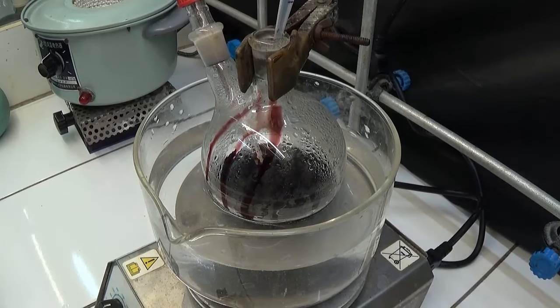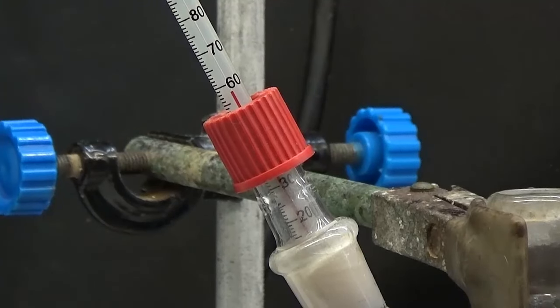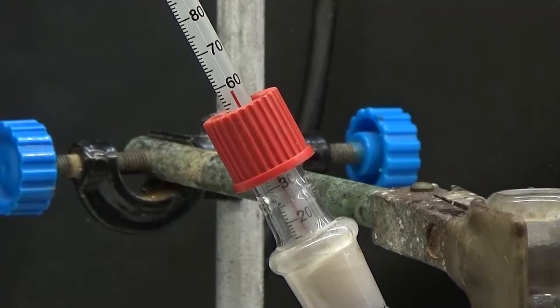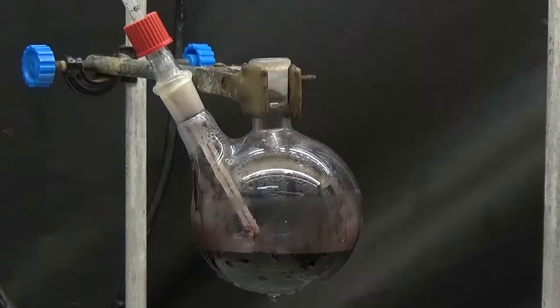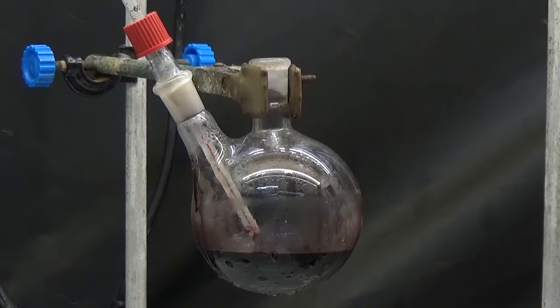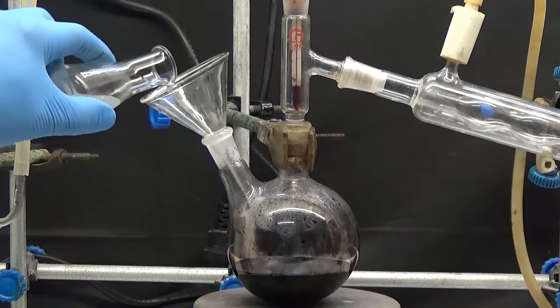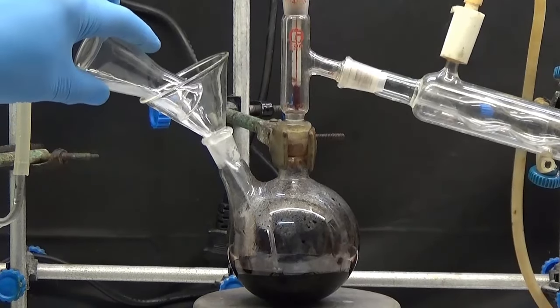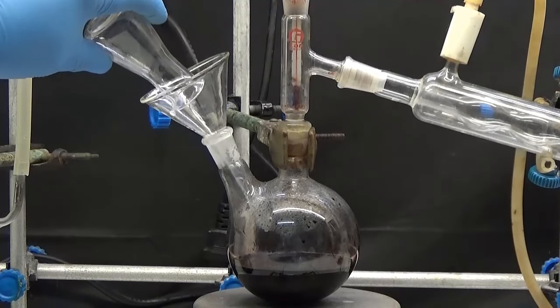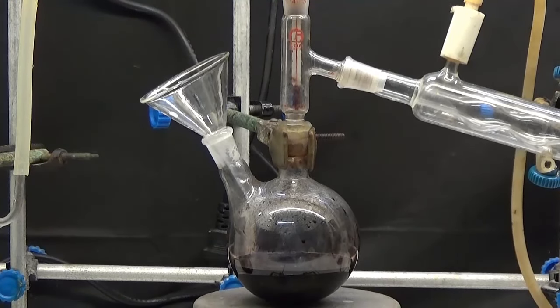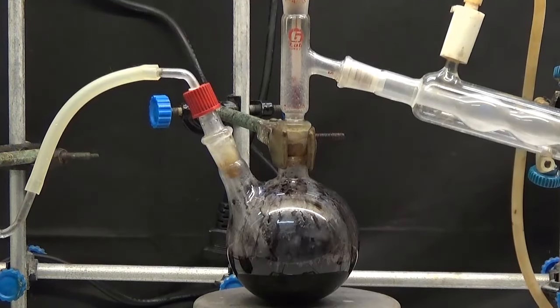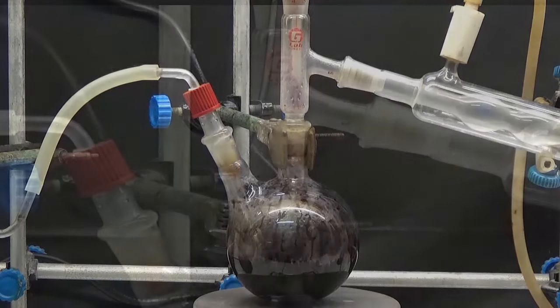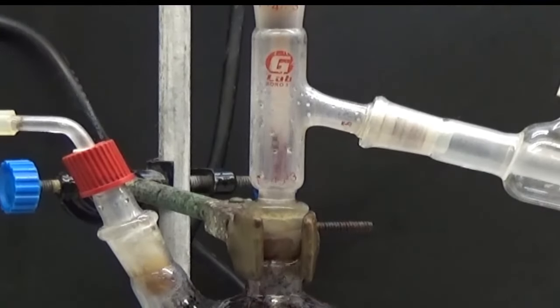As the temperature did not reach 60 degrees, I decided to warm it in the water bath at 60 degrees and to cool it rapidly with water and ice. Let rest at ambient temperature for 12 hours. Prepare a steam distillation and add a solution of 7.5 grams of sodium hydroxide in 8.5 milliliters of water. Immediately after adding the sodium hydroxide solution, the vapor tube is connected and distillation begins.